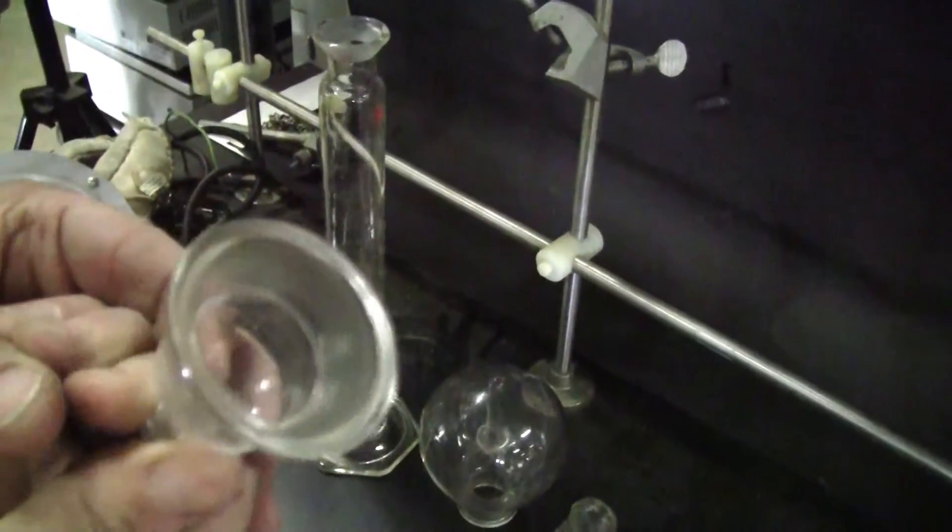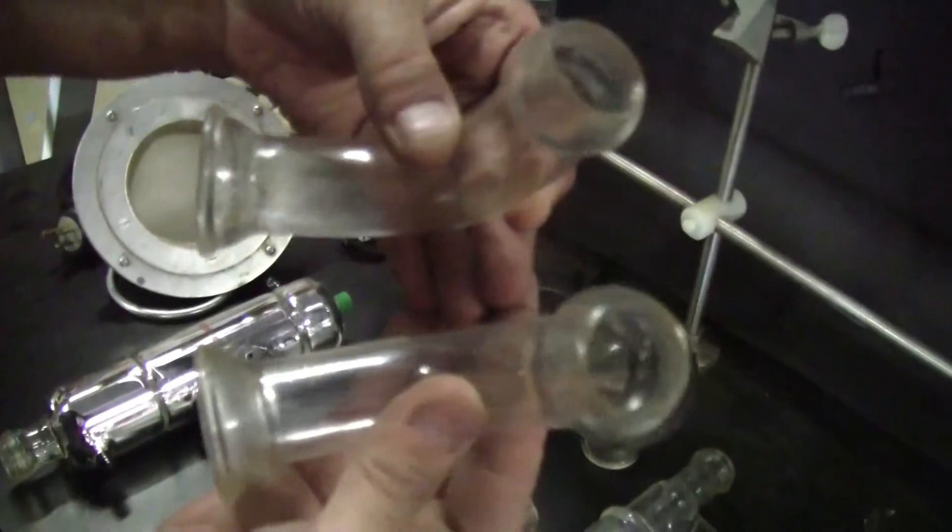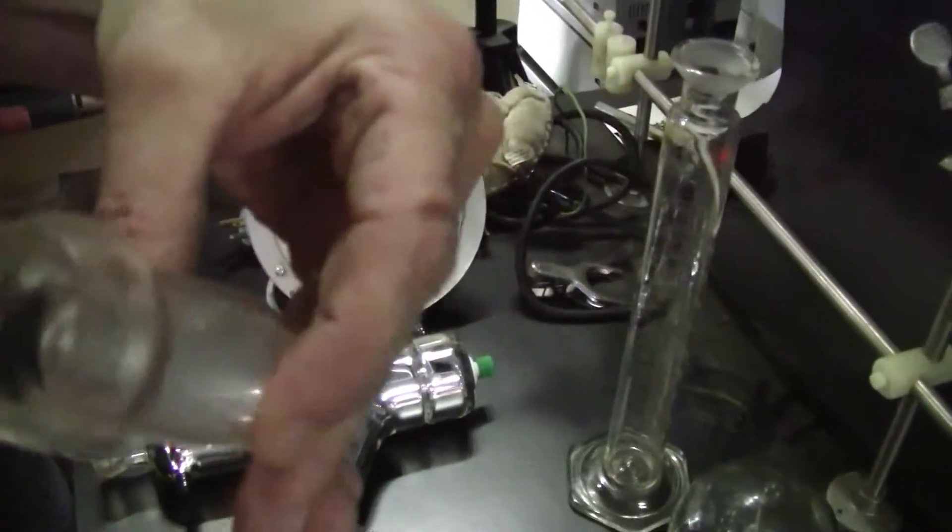Okay, looking good. Almost. A little grease hanging from there. Nothing. No chips.